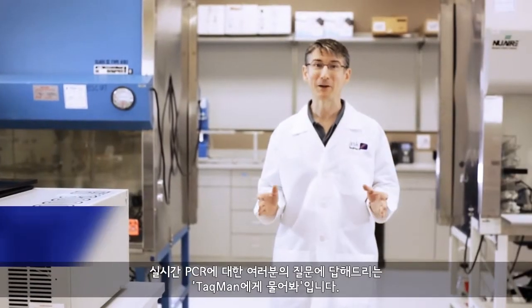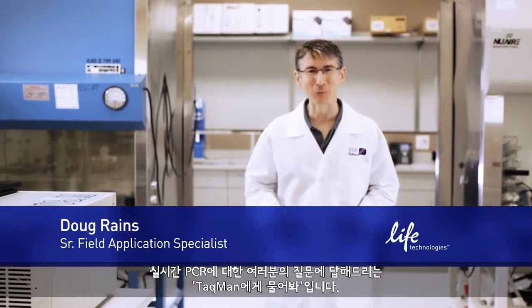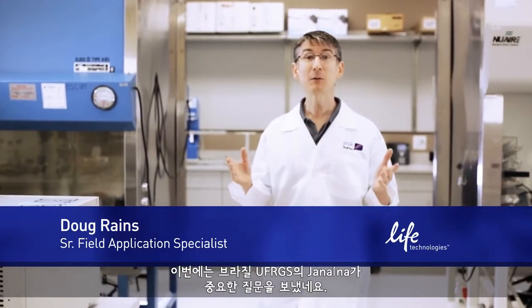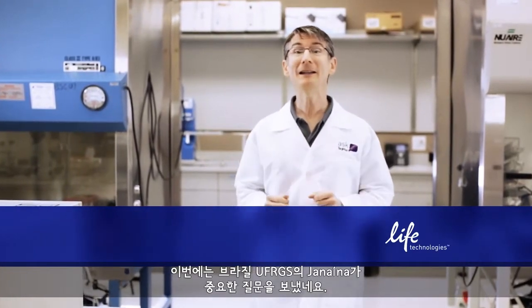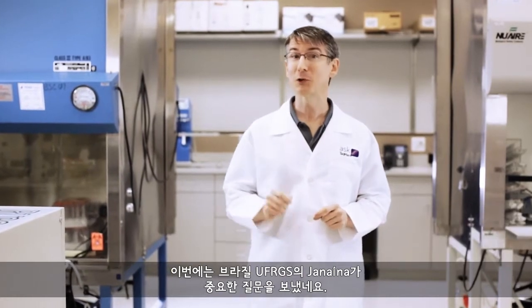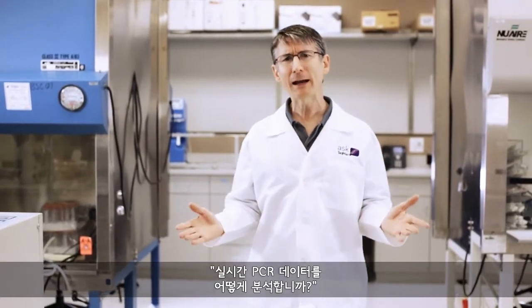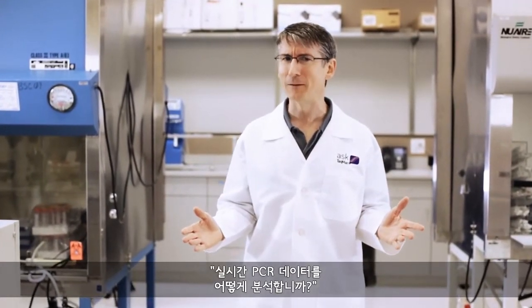Welcome to Ask Taqman, where we answer your questions about real-time PCR. Here's an important question from Janaina at UFRGS in Brazil. She asks: how do I analyze my real-time PCR data?